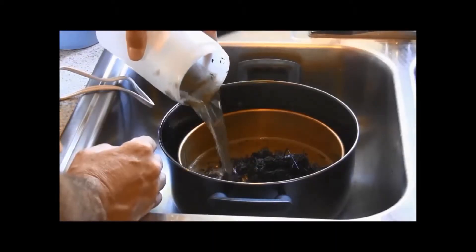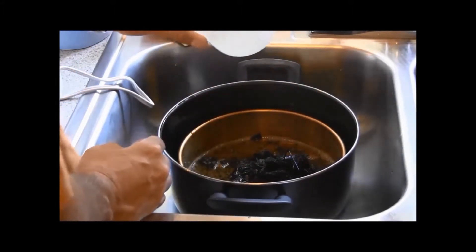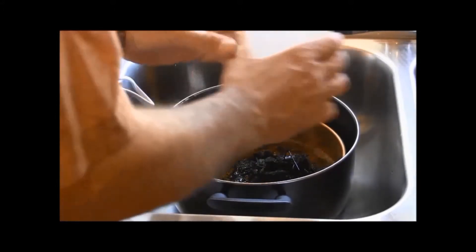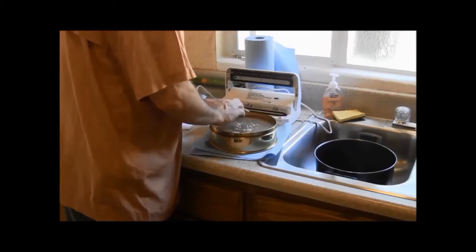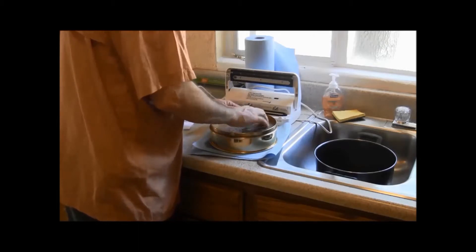To pack your unpicked sample for shipping, remove the sample from its storage jar. Carefully pour the contents into a 500 micron mesh sieve.